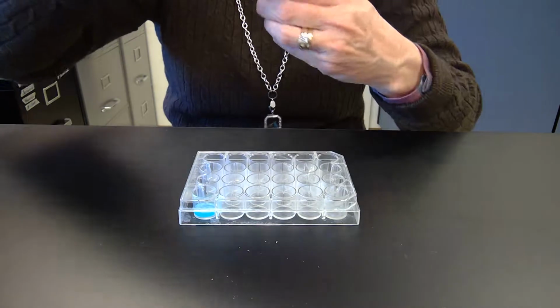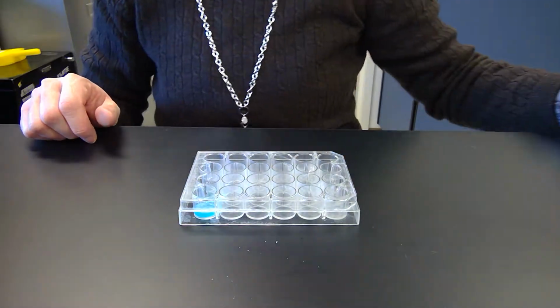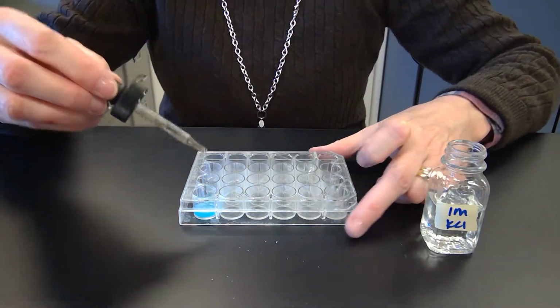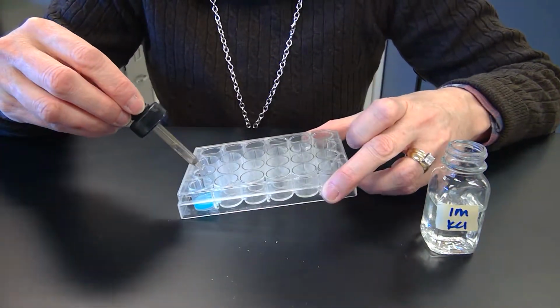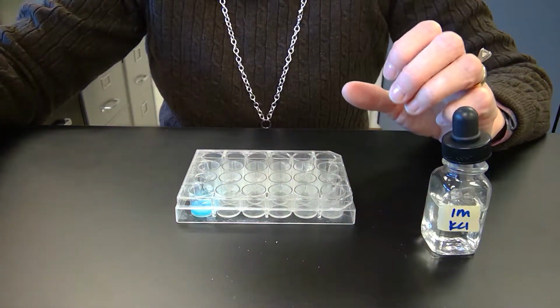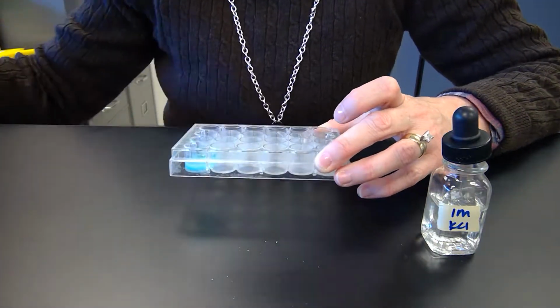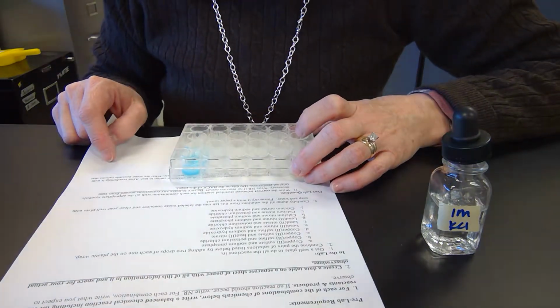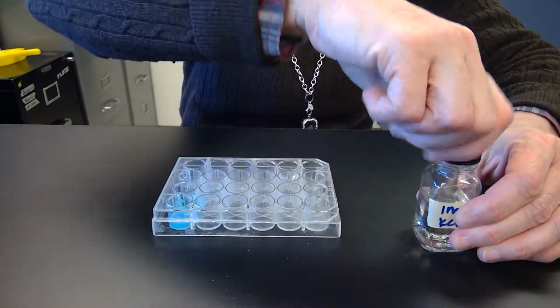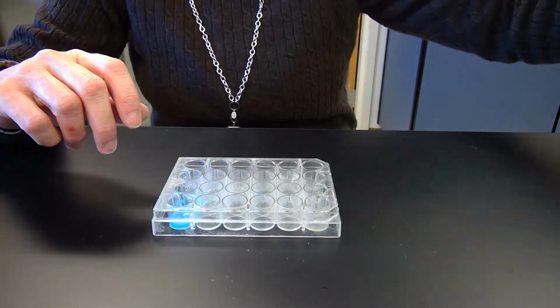And then the next one is copper 2 sulfate again, and we add potassium chloride. Potassium chloride is this little clear one, and we put a little squirt in there. Again it's just clear blue. There's not much, so I'm going to add a little bit more because I'm not sure if that's right. Alrighty, so that one didn't give me a reaction. That may or may not be right. You need to tell me if my predictions hold. Some of these weren't cooperating in class, so hopefully they'll work.